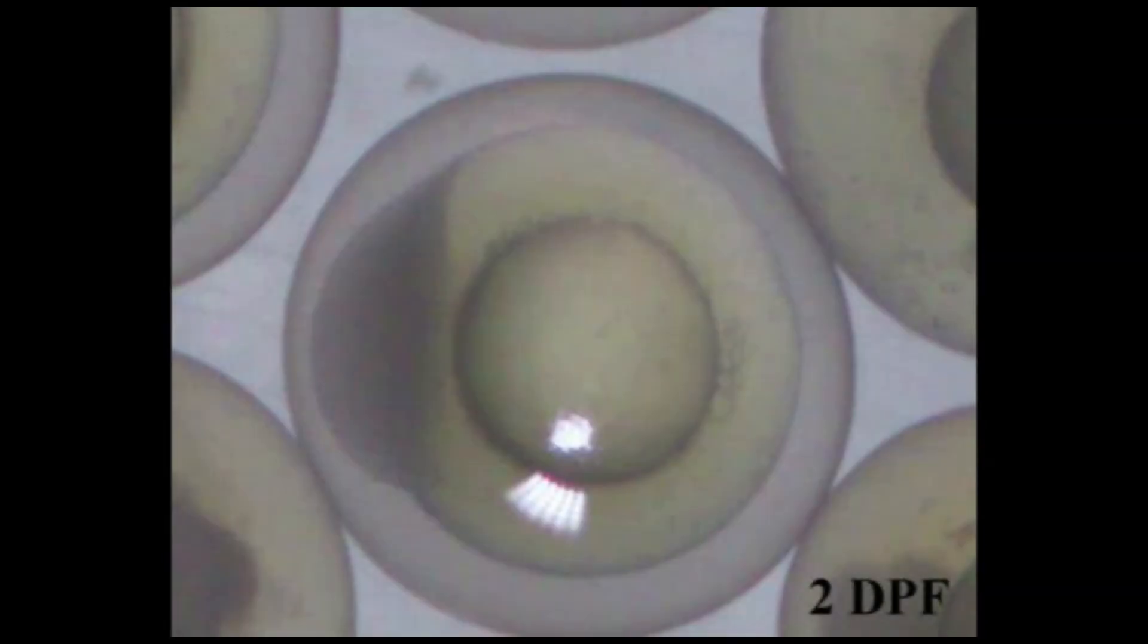After several days post-fertilization, the cell cap continues to grow as cell division occurs.